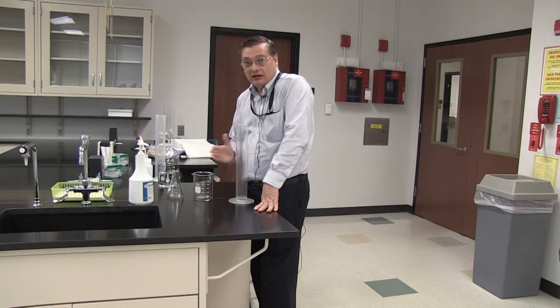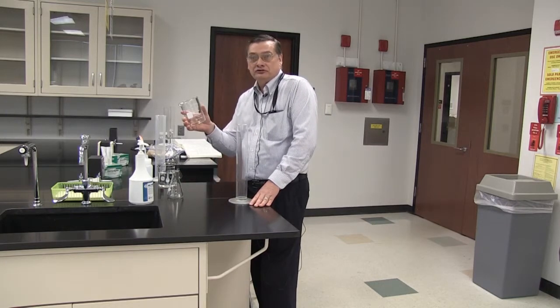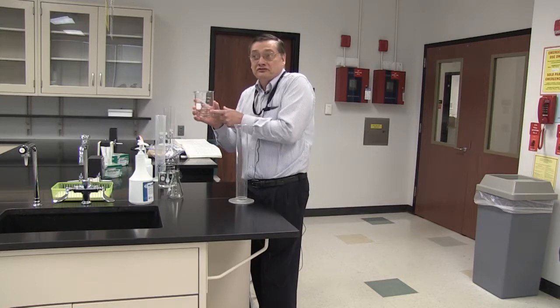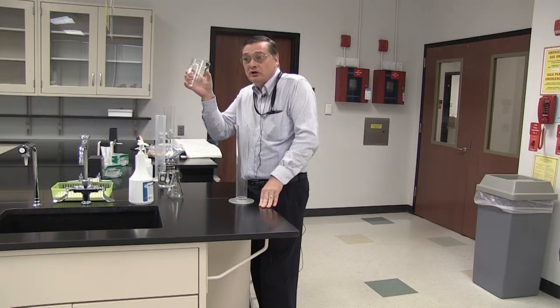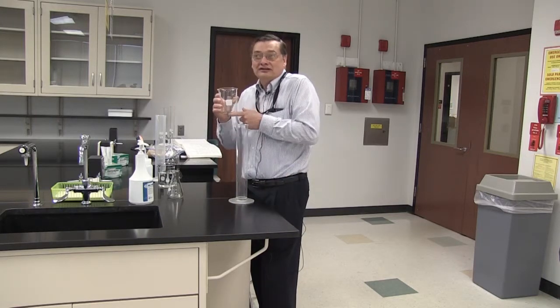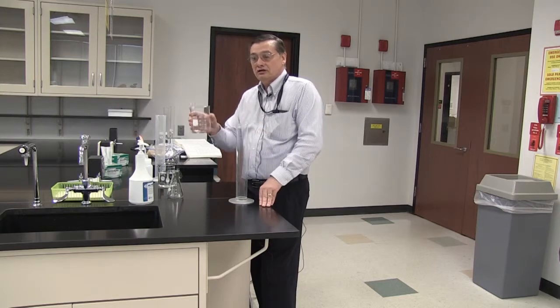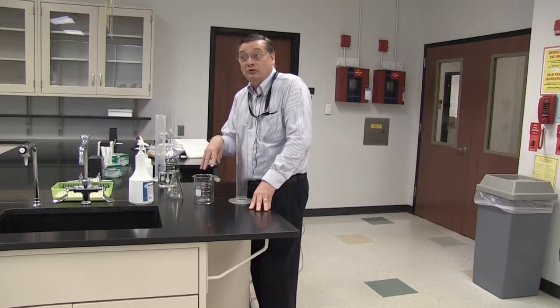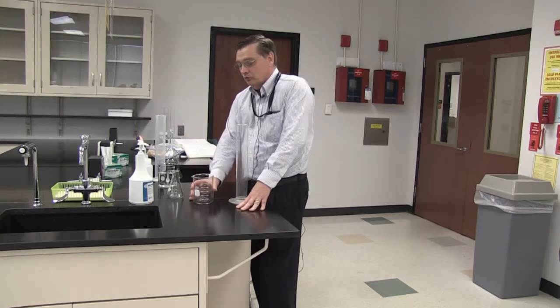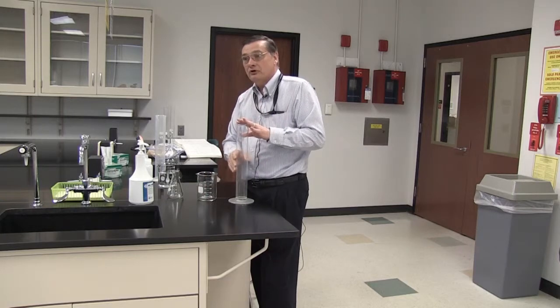So for the sake of our discussion, we're going to be looking at how that plays out in the lab. Students are often tempted to use a beaker to make up a solution. It has measurements on the side. If I'm wanting to make up 400 mils of a solution, it looks like a perfectly usable thing. But notice they said the measurements are approximate. Right? If you're wanting to accurately prepare a solution, the beaker is not an appropriate measuring device. It makes a good mixing bowl. If you're wanting to make 400 mils of something and stir it, this is a perfectly good thing. But it's not appropriate to measure.